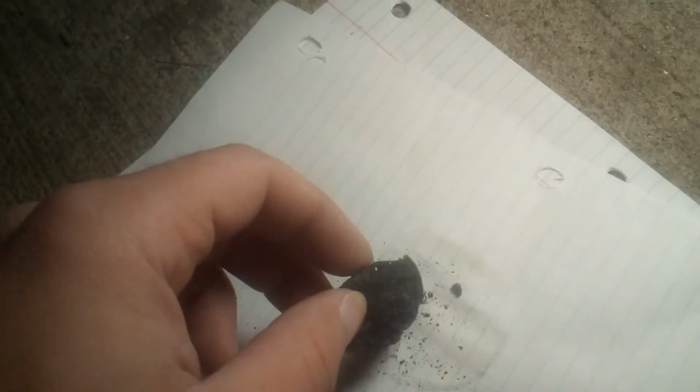Aftermath of the thermite. Most of the black material is going to be boron, some of it's going to be magnesium boride, most of the white material is magnesium oxide. So, that did not loosen it. There we go. That's most of it. And it's pretty crumbly. Feels about like lava rock.